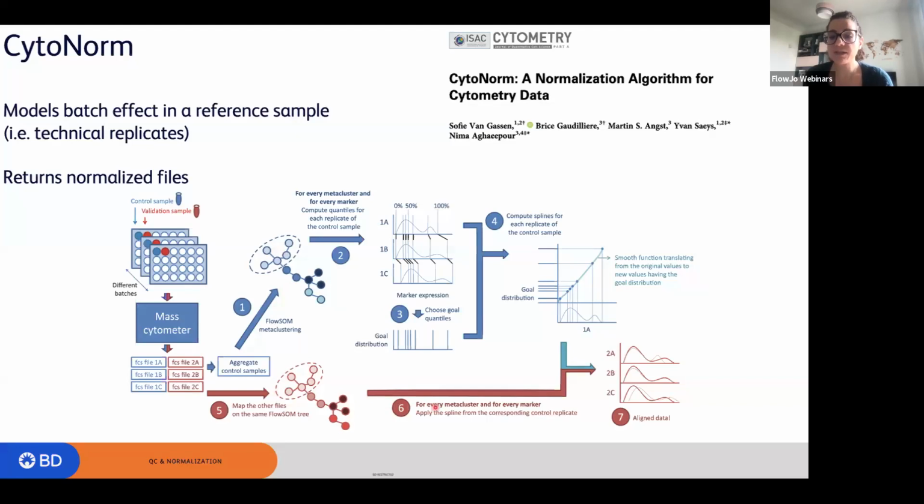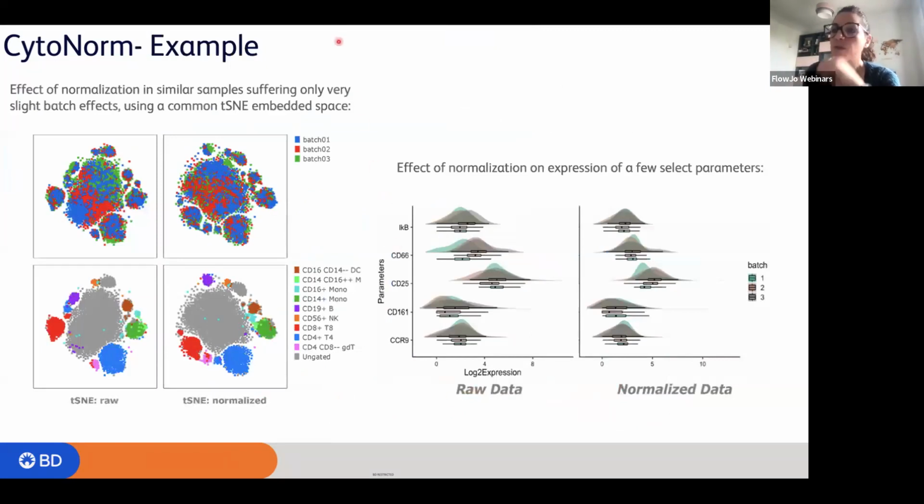And then for every metacluster and for every marker, it applies the spline from the corresponding control sample. So basically it creates the clustering on the control samples, tries to adjust everything on the control samples, and then applies those adjustments, or embeds the new samples, the actual samples, onto the control. So to give you an example, if you're doing high dimensional analysis, this is one of the things that you may see, okay?